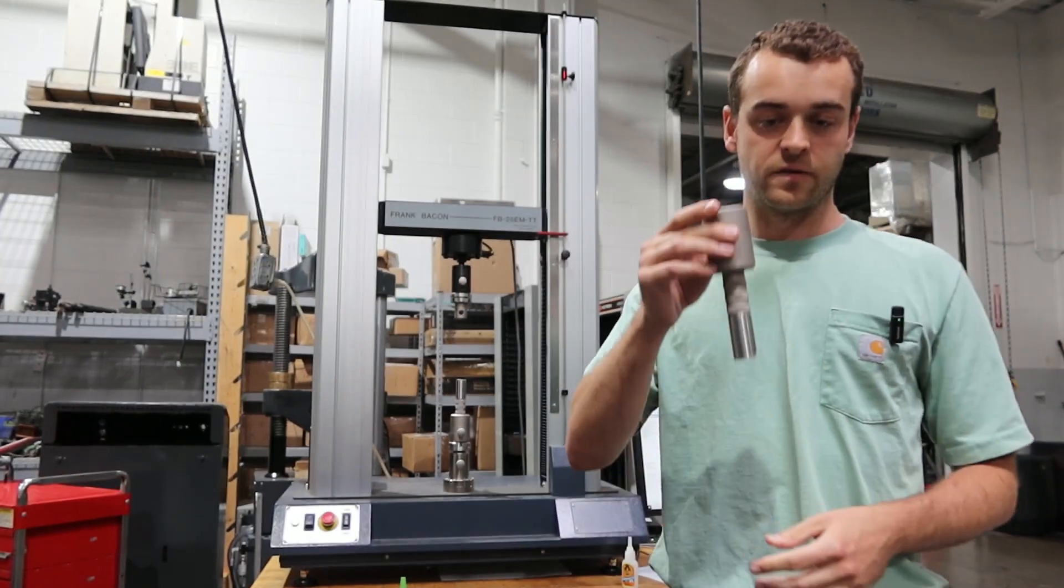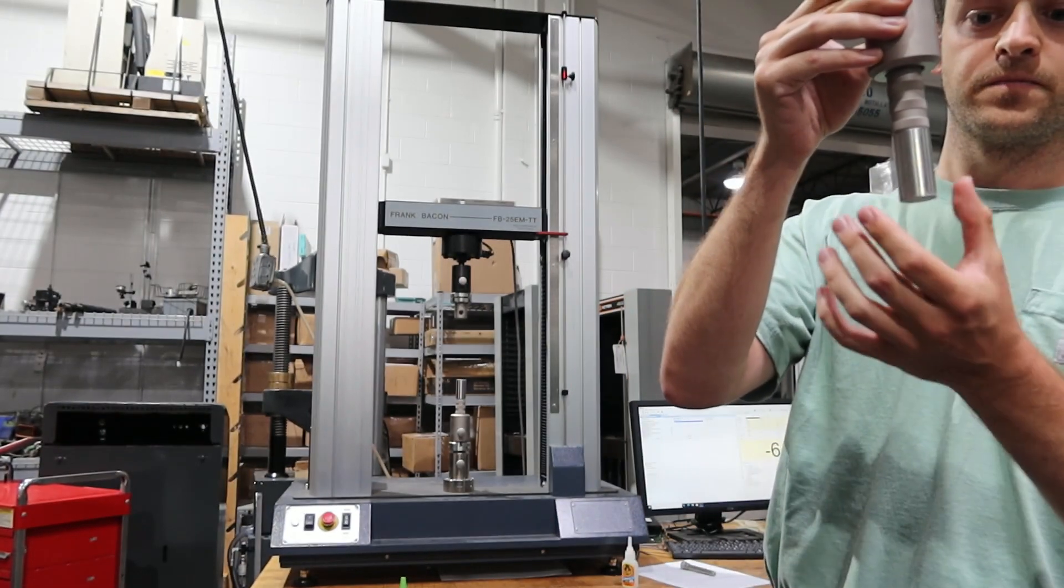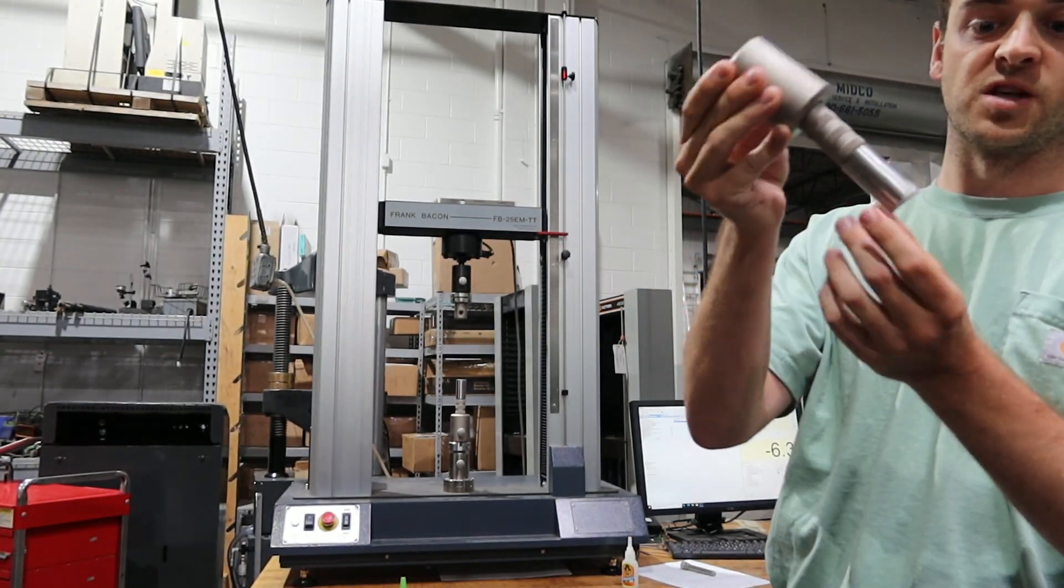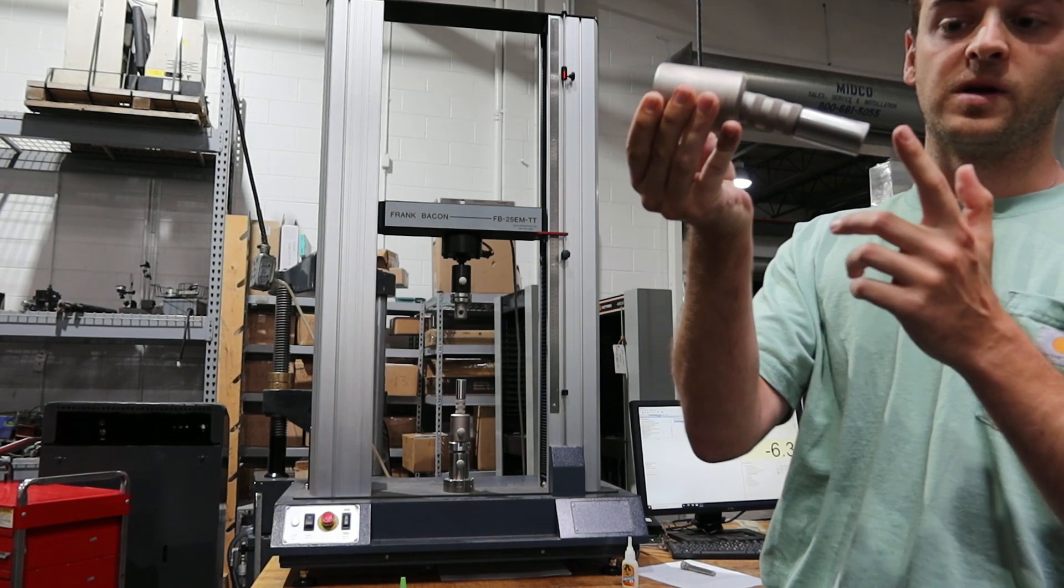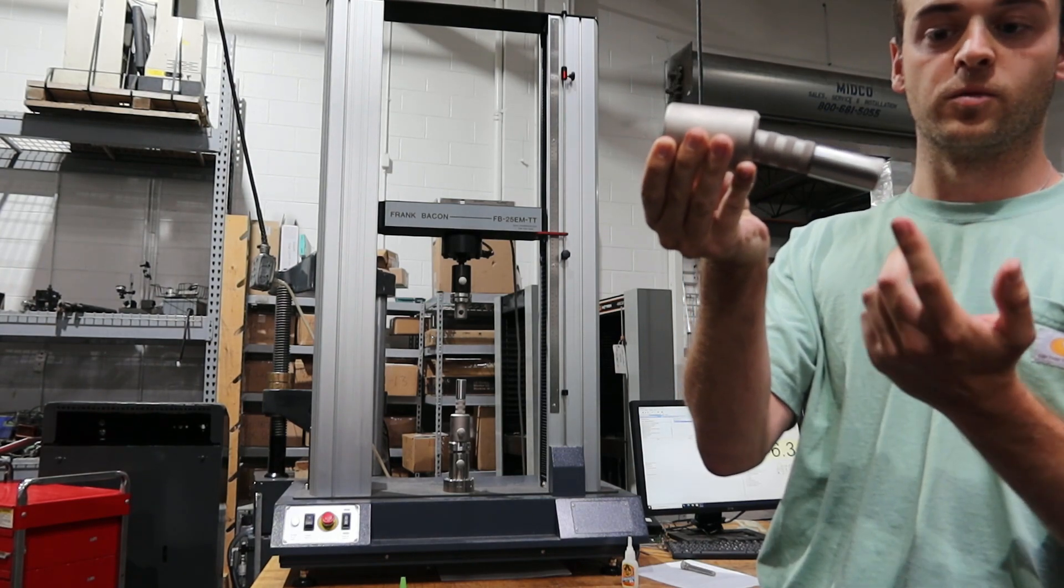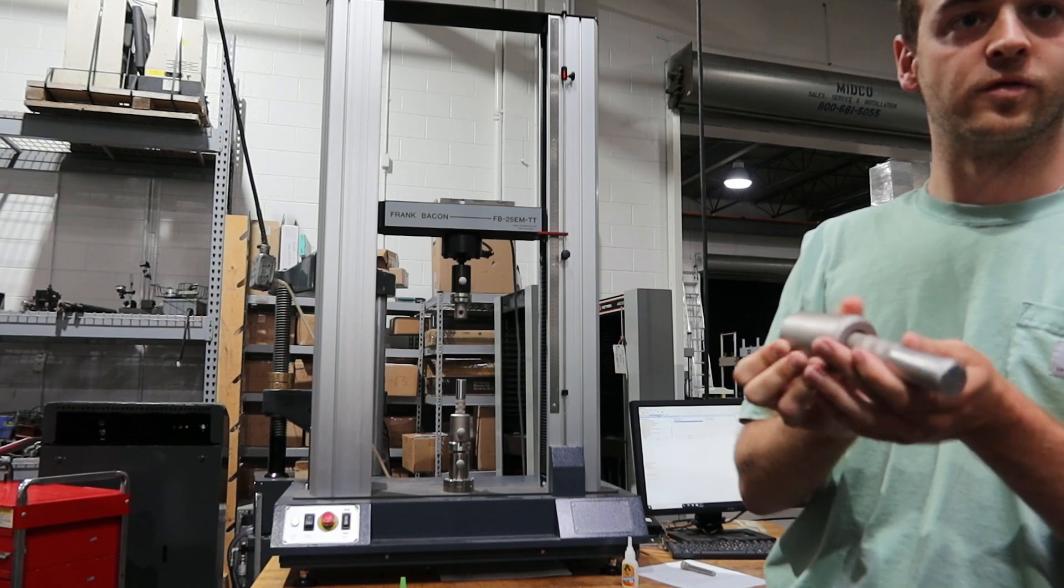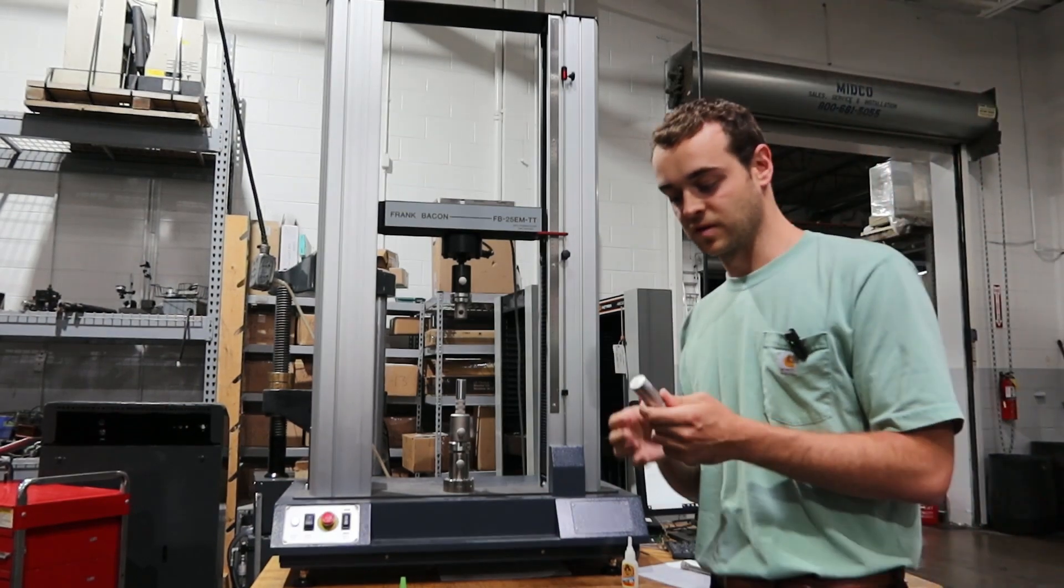So this fixture is a self-aligned piece that we're actually going to put adhesive here. You typically have a coating as well on your thermal spray coating. We're just going to do a little super glue for demonstration purposes today.